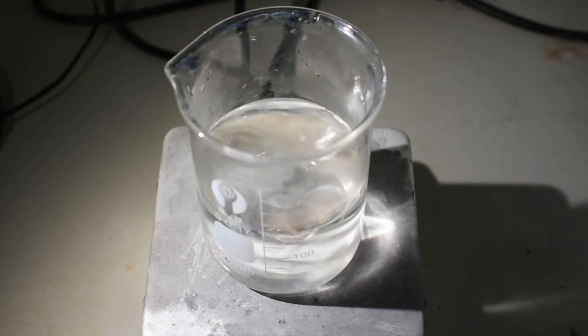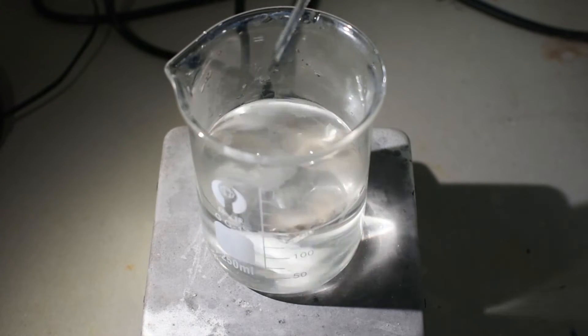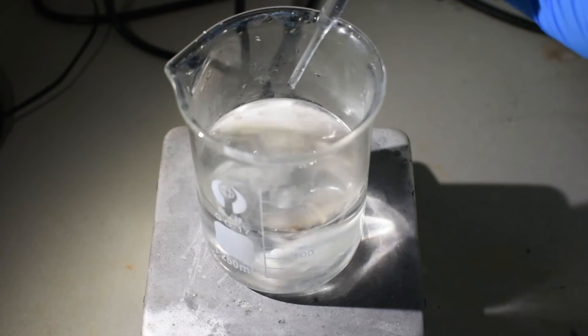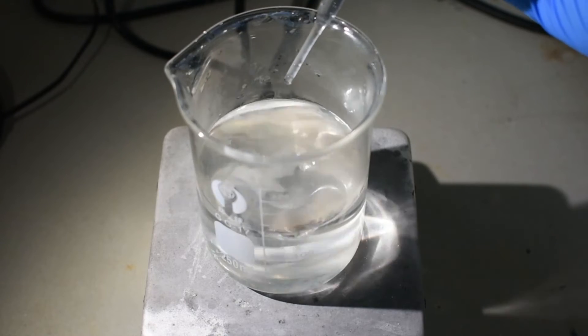Once everything is dissolved, I'm going to let it stir for a further 5 or 10 minutes, and then put this in the freezer for at least a few hours, if not overnight.